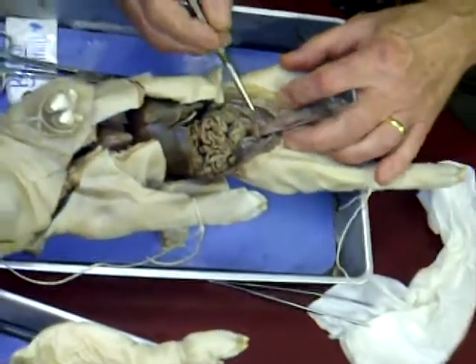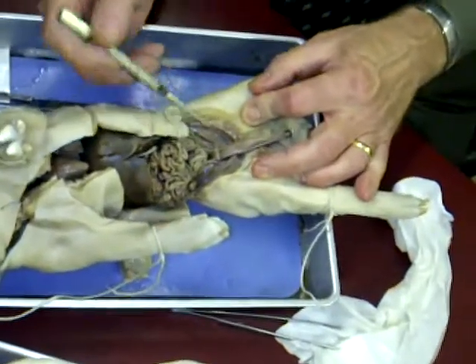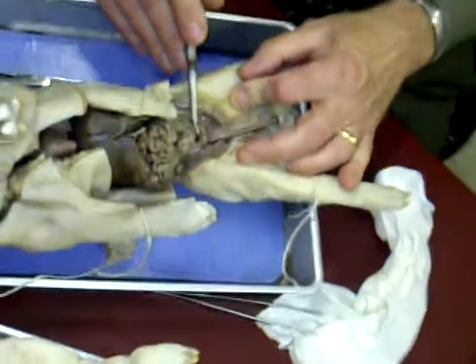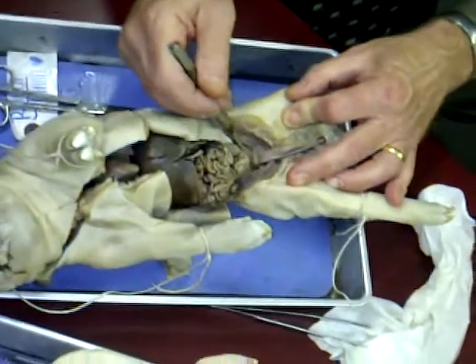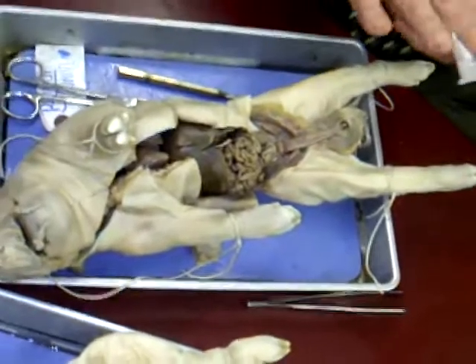It's coming from this hole in the floor of the abdominal cavity, and you also have this spermatic artery and a nerve going right into the same hole. And those holes in the abdominal cavity, one on the left and one on the right, are called the inguinal canals. And I believe that those are in the book in bold type.